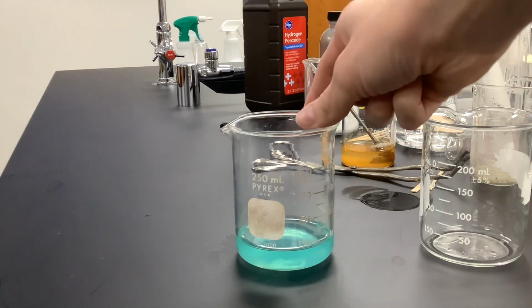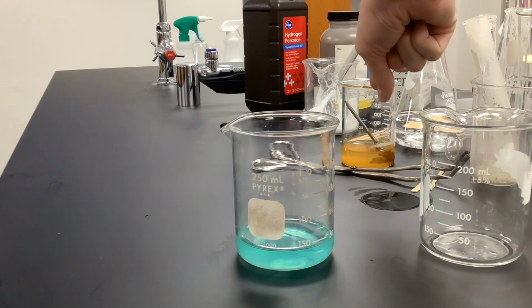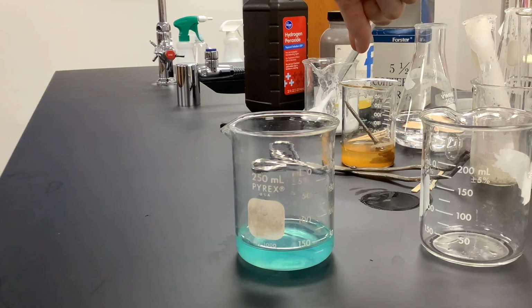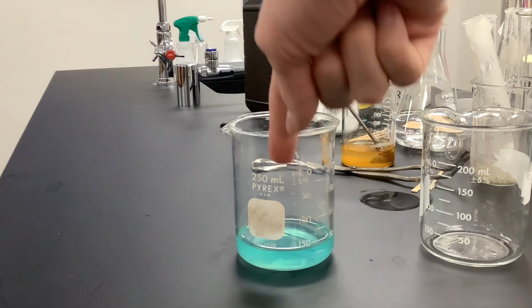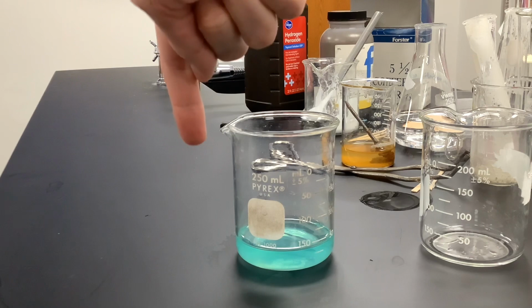So when I put this in here, a chemical reaction is going to happen. We're just going to set it up for now, and then we'll look at it again after you guys do your reaction type teaching. The one that I have back here, that I set up on Monday. What day is it today? Thursday. Okay, 4 days ago. That's when I set up, 4 days ago, and I just left it sitting there. So we'll see what this one looks like after 20 minutes or so.